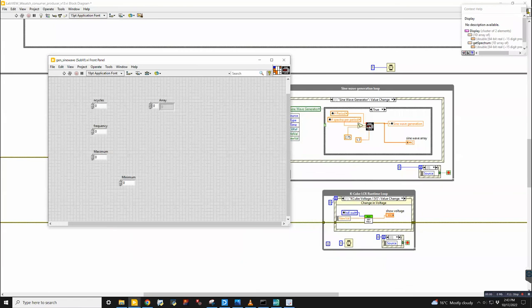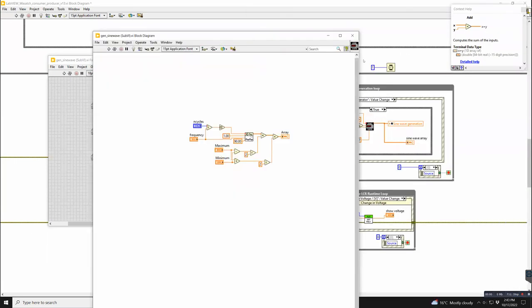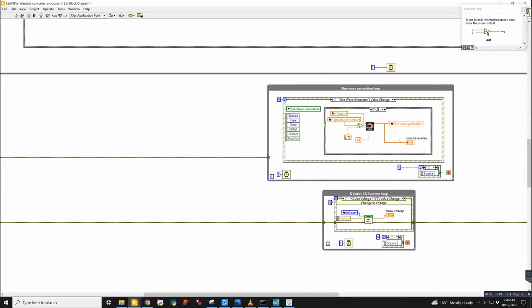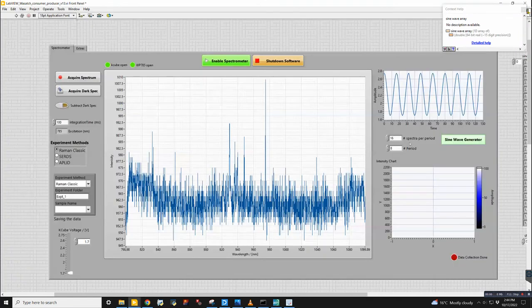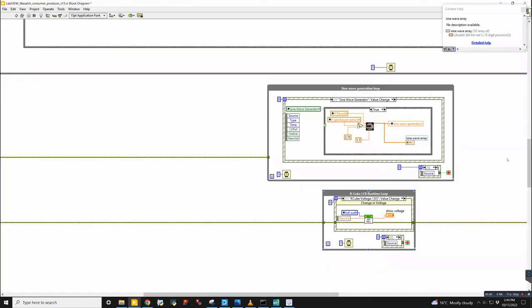So we have this sub VI that runs, and basically it takes in all the parameters that we want for the sine curve, and it spits out a 1D array of the voltages that we want to put into the K cube. The mouse is lagging. Okay. And it dumps all of that into this sine wave array over here. And this is the array that we loop through for the applet.